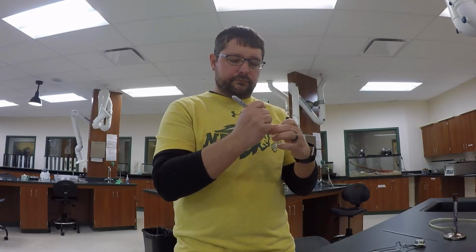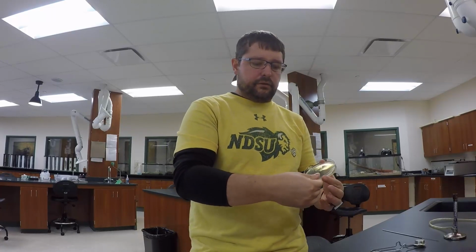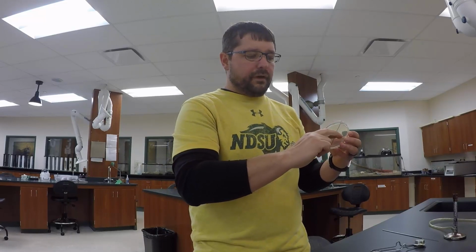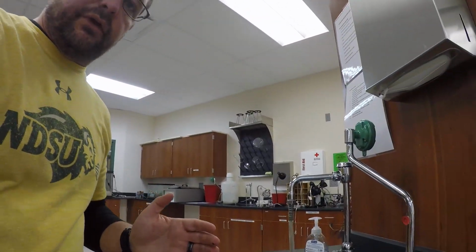Again, so straight line down the dish. Now to one side, which I am going to label dirty, I'm going to take my index and middle finger, and I'm just going to rub them down that side, just like that. Now that's dirty. Okay. I'm going to close that because now I'm going to wash my hands with some material.